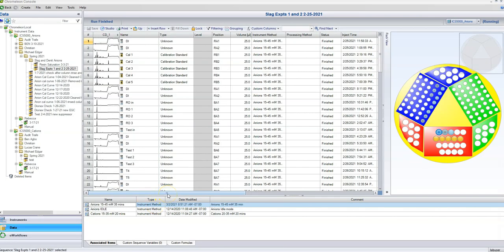All right, so congratulations on making it this far. Now let's get our data off of the IC, the moment we have all finally been waiting for. So, obviously we're going to start by going into our file and finding our finished run. I'm going to be using this one as an example because we have all of the data and there is no processing method for it.